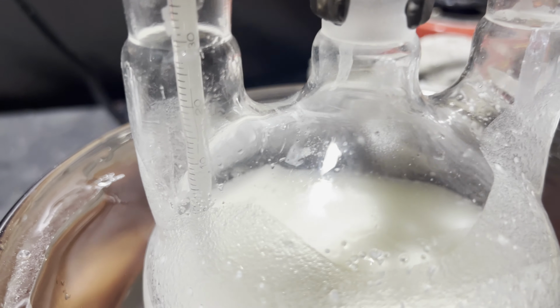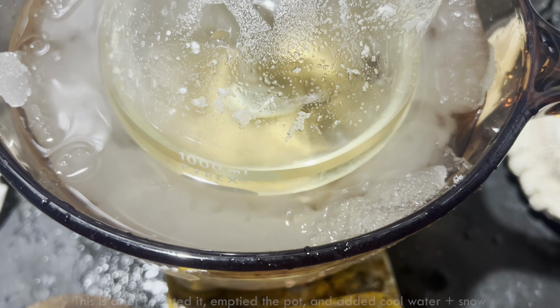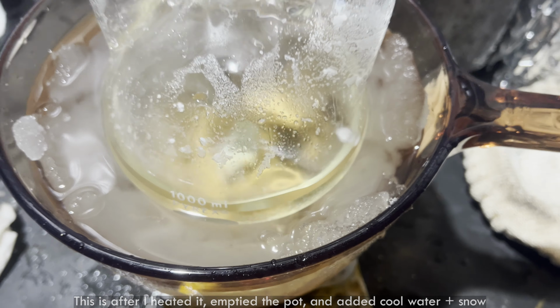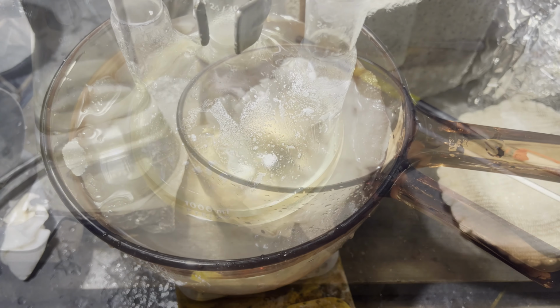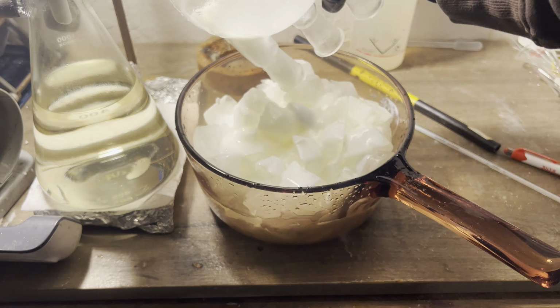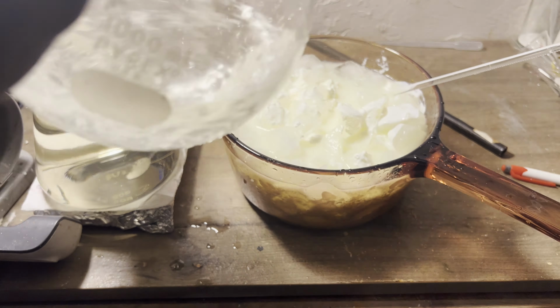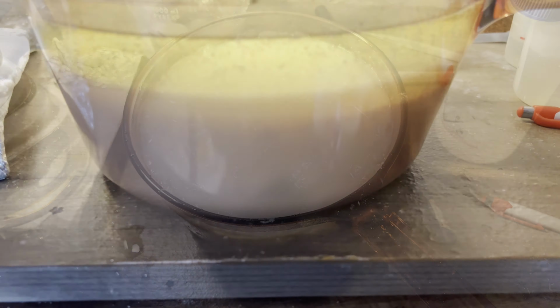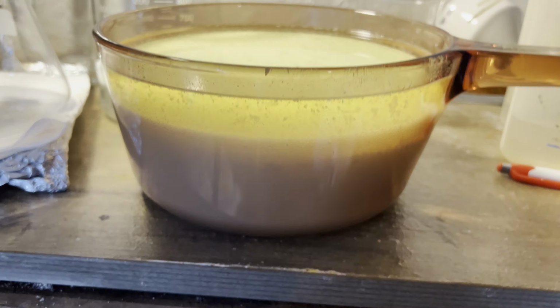mixed acid, which took about 2.5 hours, and then I heated up the ice bath to make it a hot water bath until the reaction mixture became clear, which was at about 60 degrees. After letting it cool, I poured it into ice like before. I used this glass pot since I don't have a beaker big enough. I filtered it in 3 batches since I don't have a filtering flask or funnel big enough.